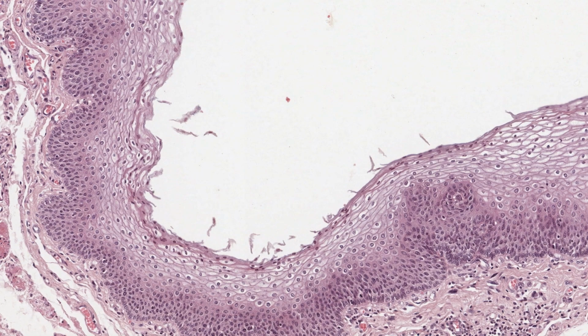The inner lining of the esophagus provides an excellent example of a thick, stratified squamous epithelium. Squamous means scale in Latin. There are many cell layers between where the basement membrane would be and the lumen. The deeper cells are not squamous at all.